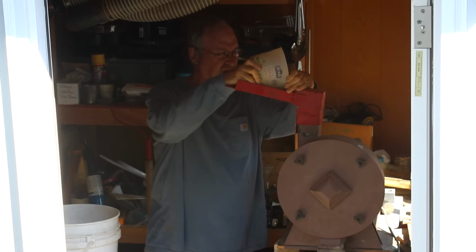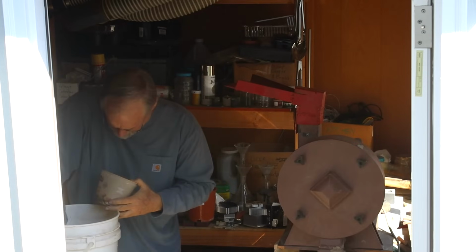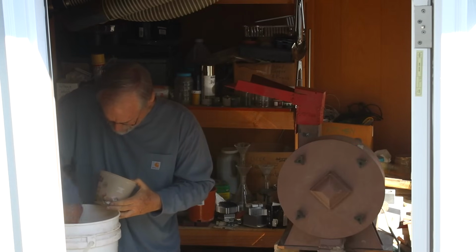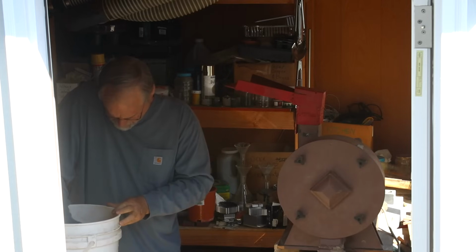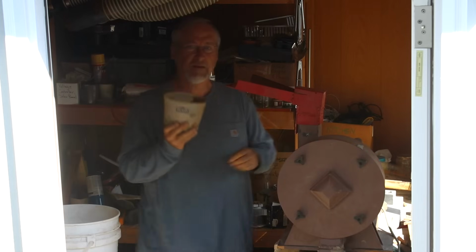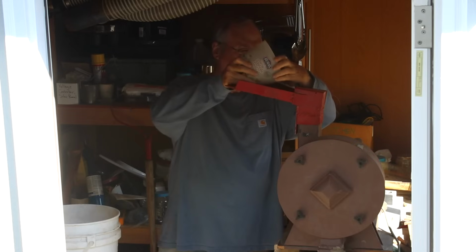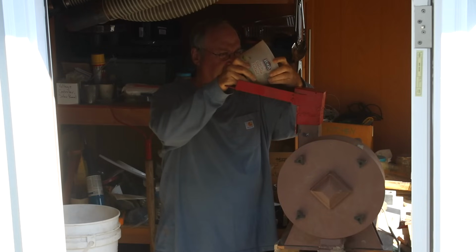The round chain mill has 4 sets of chains that spin around from a motor at a really high rate. And that just smashes the ground up ore to bits because the chains are spinning so fast. At the bottom, we have material sucked out, and that's been fully crushed because it passes through a screen. I have to feed it in slowly because if you feed it in too fast, it just fills up and the screen gets blinded.